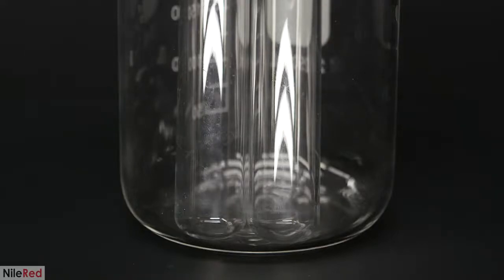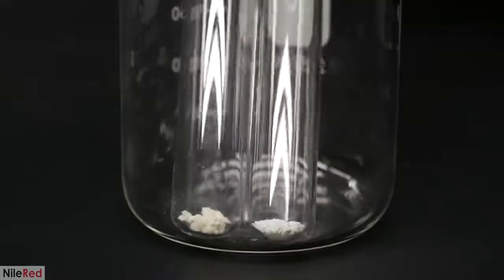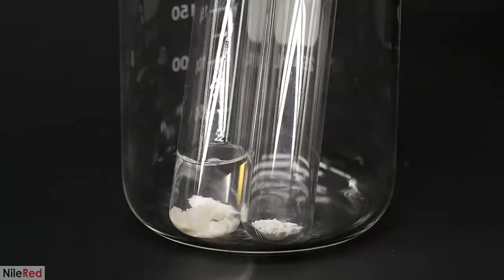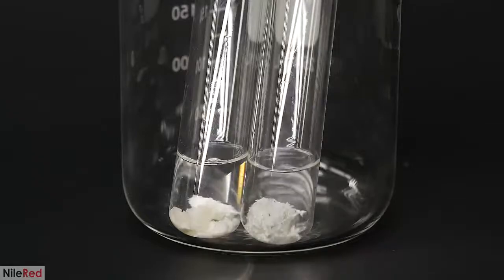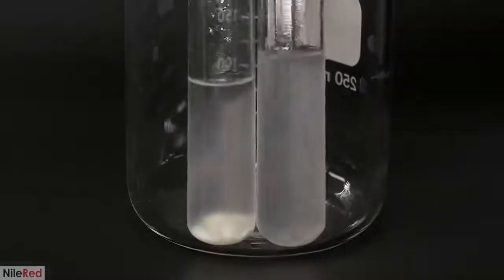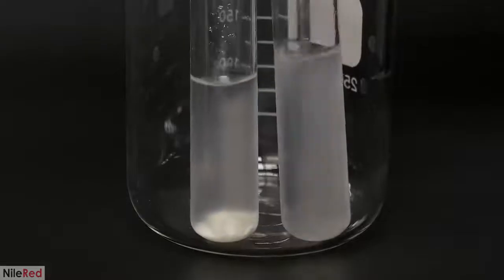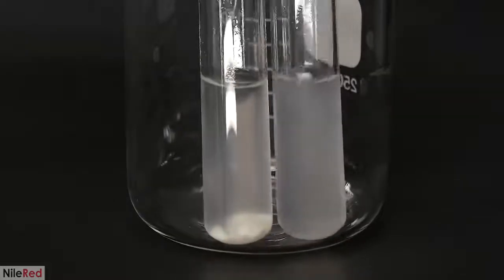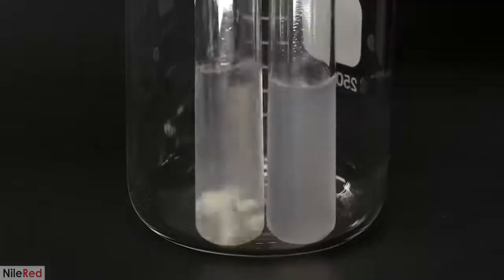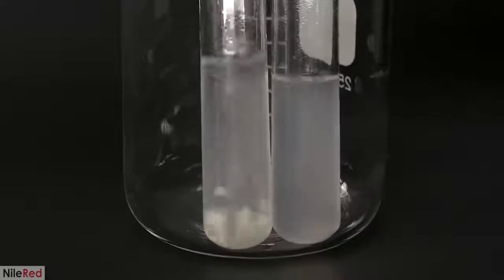The test is really easy, and I just need to see if they dissolve in acetone. So I add a small amount of each to 2 test tubes, followed by an equal amount of acetone. I ended up adding more acetone to speed things up, and all of the diacetate eventually dissolved. However, most of the triacetate still remained. This is exactly what's expected to happen, and it confirms that I did make 2 different products.